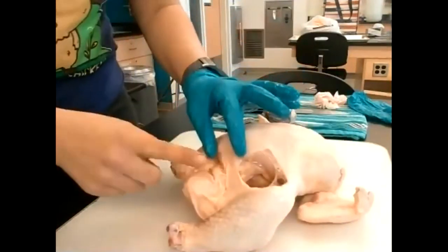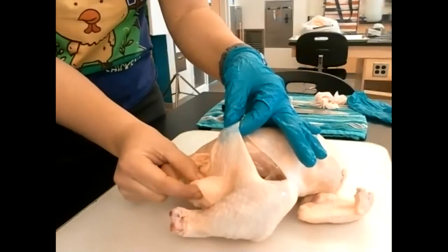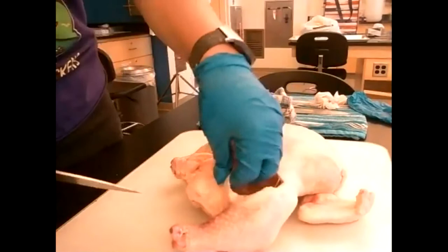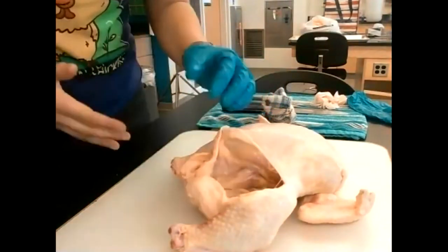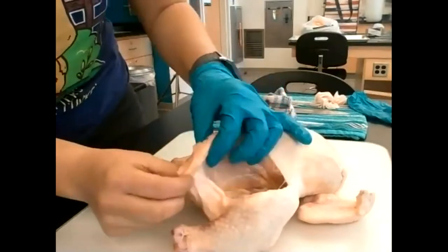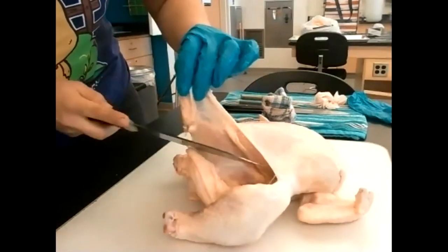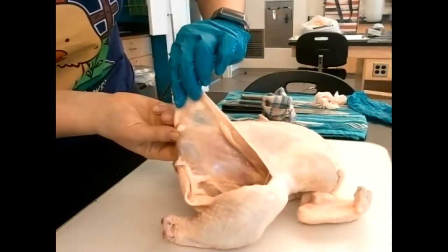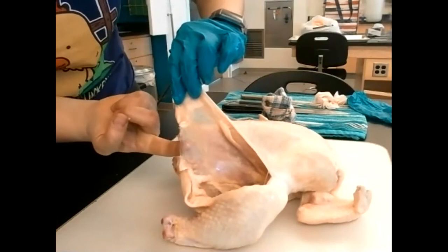Now that I've made one minor incision, I'm going to keep cutting the skin all the way down to the tail, feeling the pelvis bone. I've cut through the muscle until I feel bone here. Note that this is abdominal muscle — you can see my finger through the fascia, but not through the muscle. This is abdominal muscle and this here is fascia.